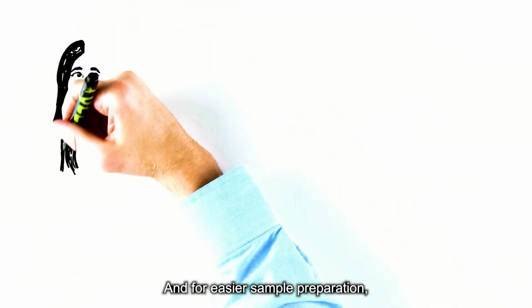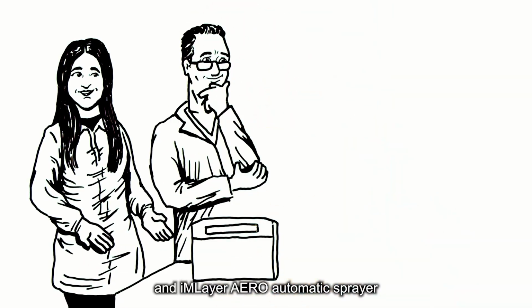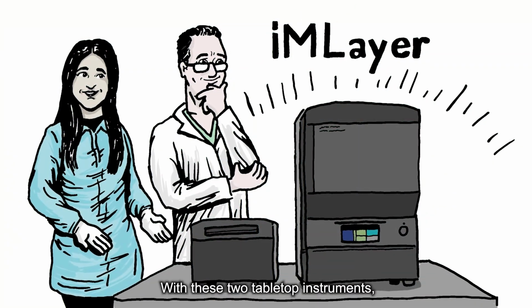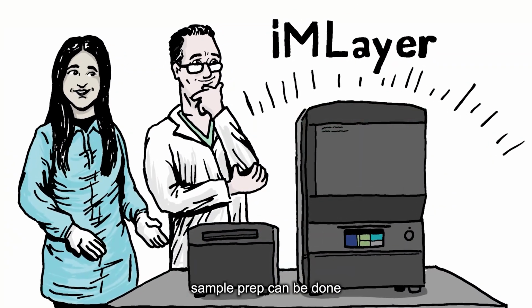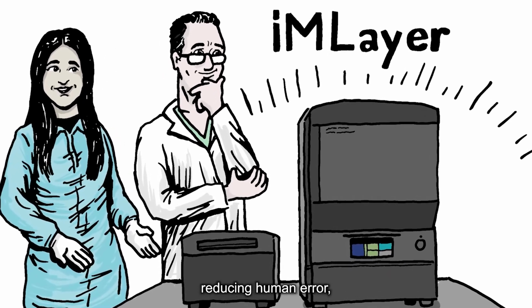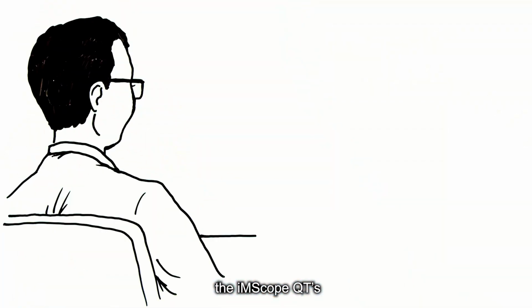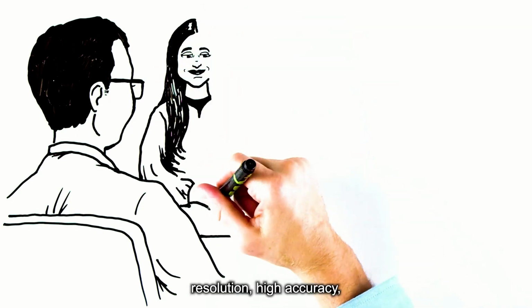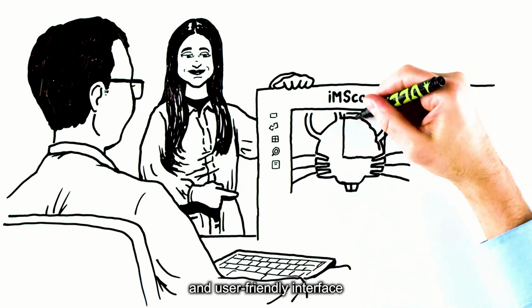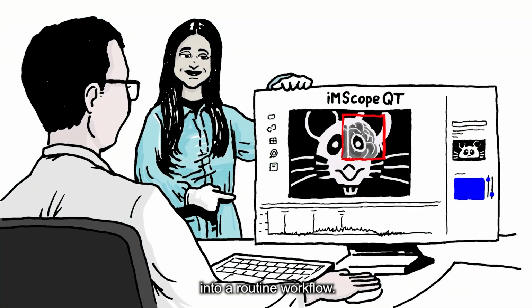And for easier sample preparation, Shimadzu offers the iMLayer matrix deposition system and iMLayer Aero automatic sprayer for MSI. With these two tabletop instruments, sample prep can be done with minimal training, increasing accuracy, reducing human error, and enhancing repeatability. Altogether, the iMScope QT's subcellular pixel resolution, high accuracy, ease of sample preparation, and user-friendly interface simplifies a previously arduous set of tasks into a routine workflow.